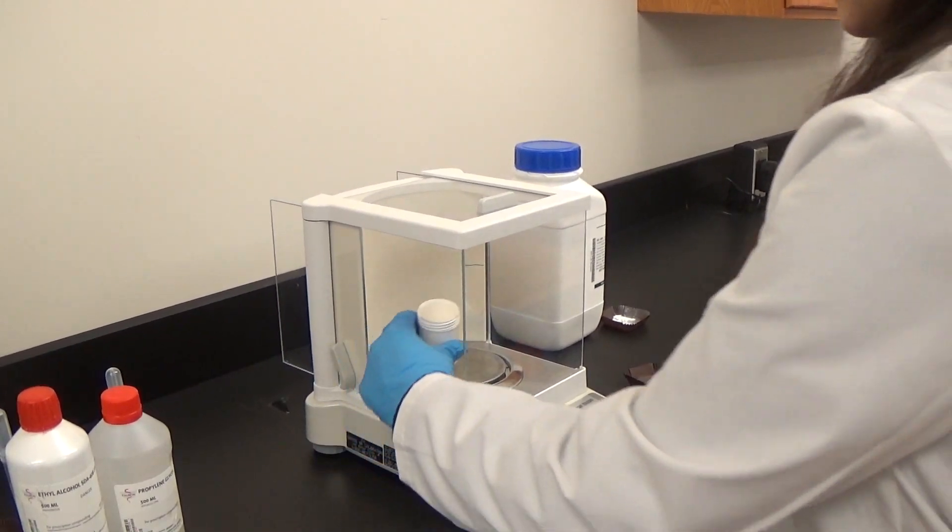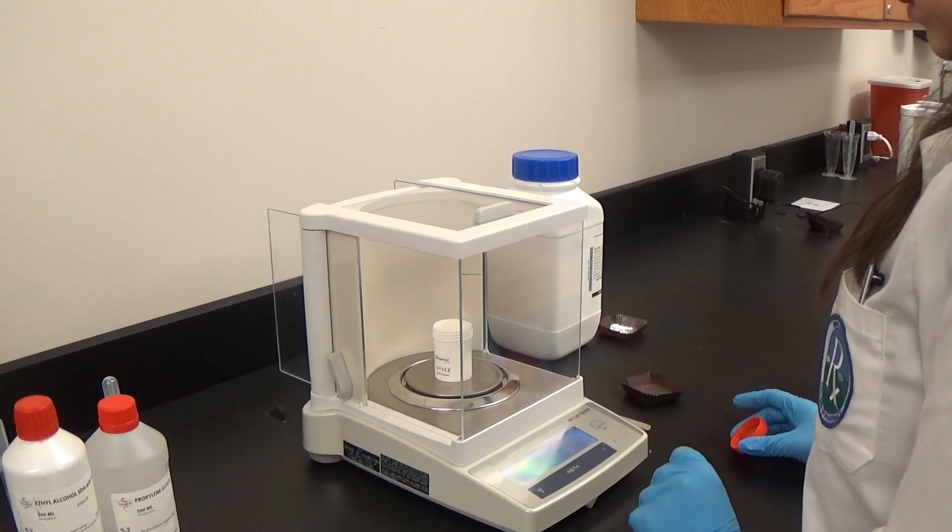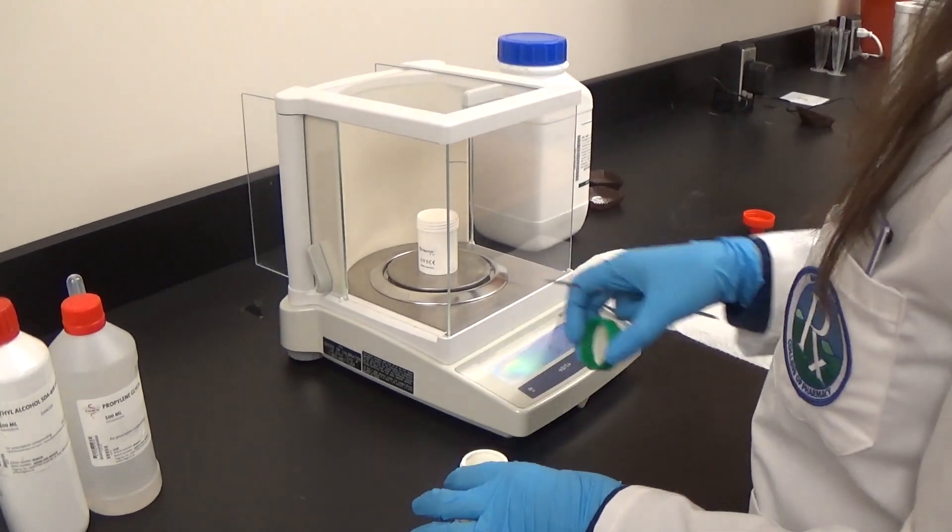To compound the carbomer-based lidocaine gel, place a suitable dispensing container on the scale. Be sure to tare the weight scale to zero.